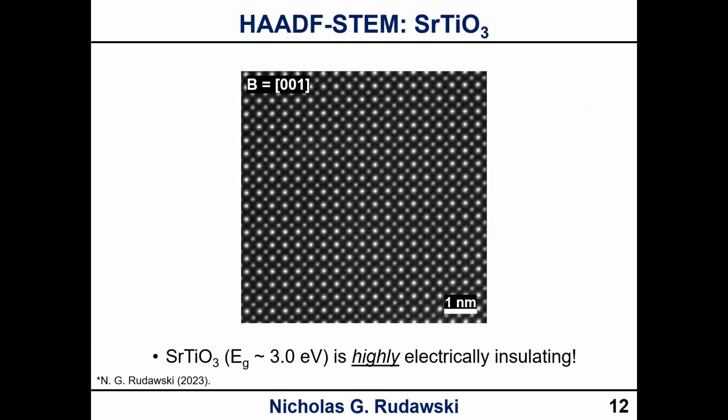Right, and then the last example, strontium titanate. Again, very high band gap insulator, and highly electrically insulating. And this is probably the most studied and imaged material by HAADF-STEM ever, is probably strontium titanate as viewed upon the 001 zone axis. You will probably find more HAADF-STEM images of this particular material along this zone axis than any other sample. Possibly even silicon along 110. But I haven't done a complete survey of that, okay?